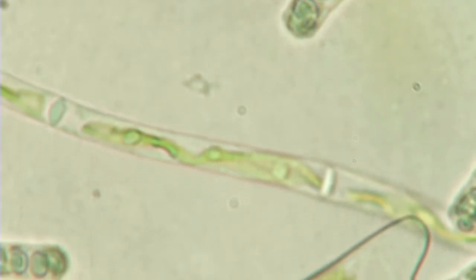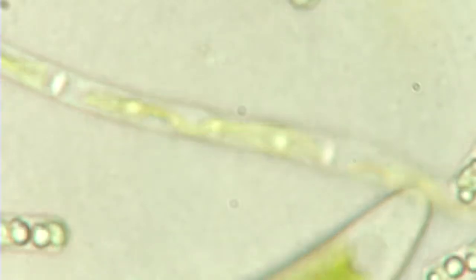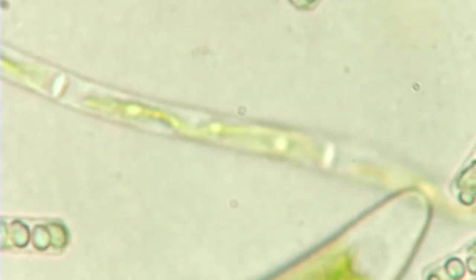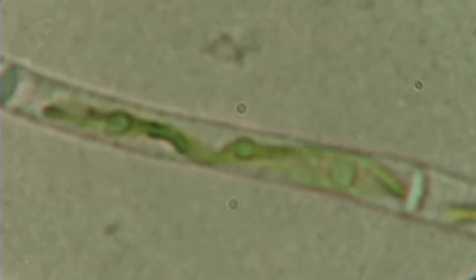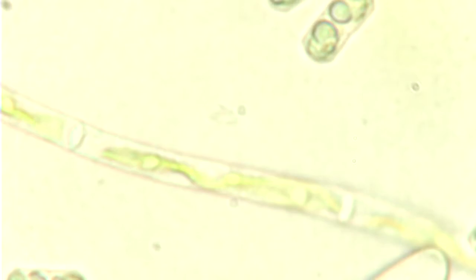It's fuzzy though, blurry. Don't take that, that's ugly. I'm working on it. That's worse. It's a little bit — you can do it. It's so wet, this slide is so wet. I'm going to heat it up.